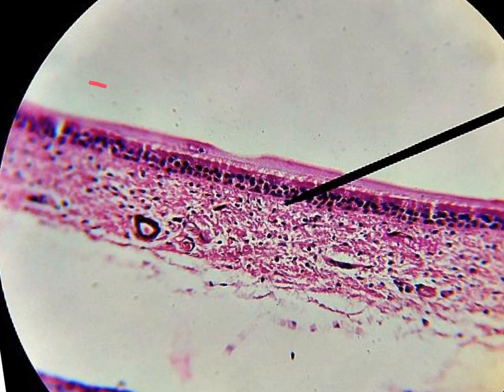This is at first the basement membrane, and then we have two rows of these rounded nuclei, and then we have the rest of the cytoplasm of the cell.